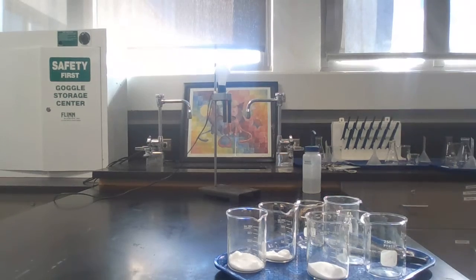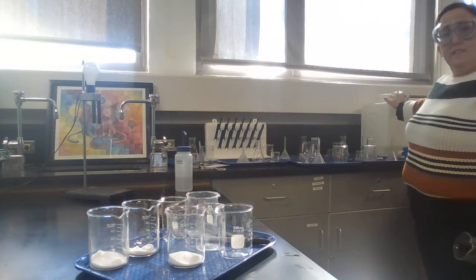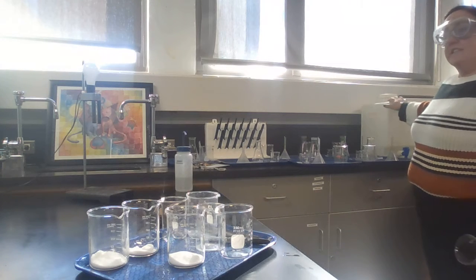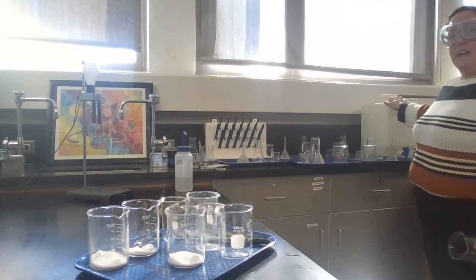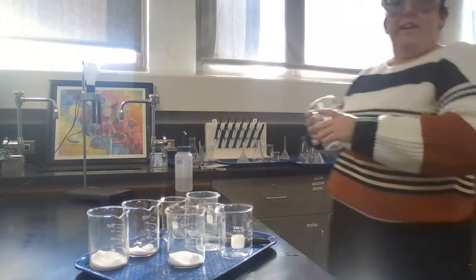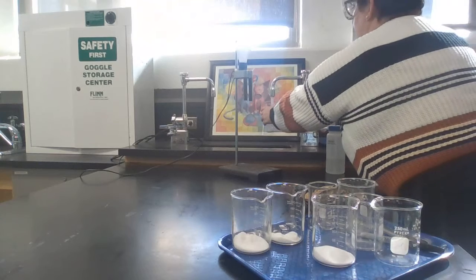So what you want to do is take your water beaker to one of these things right here. Okay, there's one here and there's one on the other side. This is distilled water, which means it does not have ions in it. Since what we're testing here is whether something is ionic or covalent, if we use tap water, which has ions, we might get incorrect results. I'm going to use tap water as my demo because I buy the distilled water, but you should not be using the sink at all.